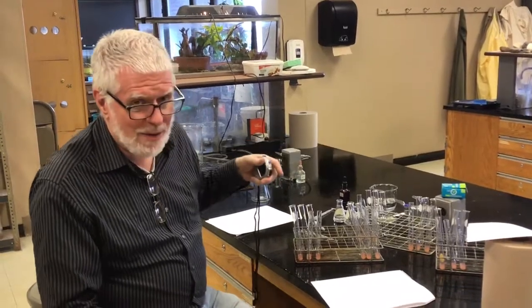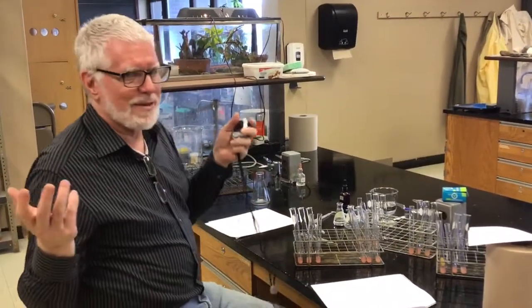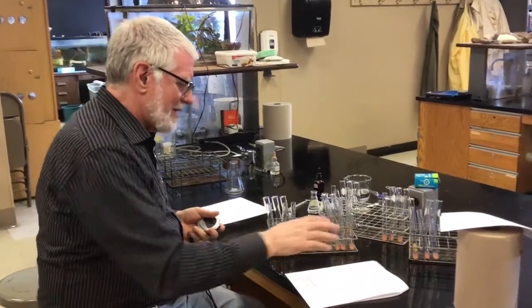The substrate is hydrogen peroxide, remember? And so we're gonna put increasing amounts of hydrogen peroxide in and measure the time to the line, which is our substitute for reaction rate. So you've got your data sheet. We're gonna start with 1 milliliter. We have 1 milliliter of hydrogen peroxide in the back test tubes to pour into the front test tubes. And so this is gonna be trial 1.